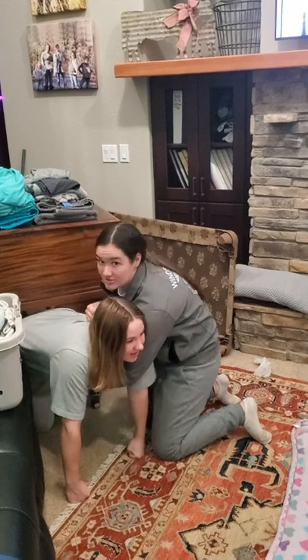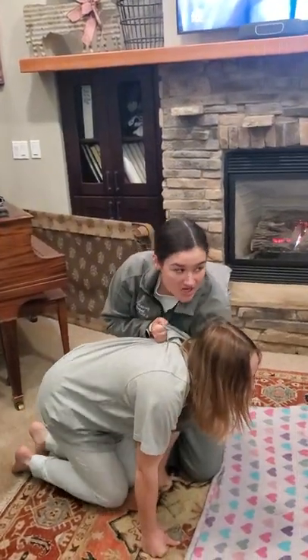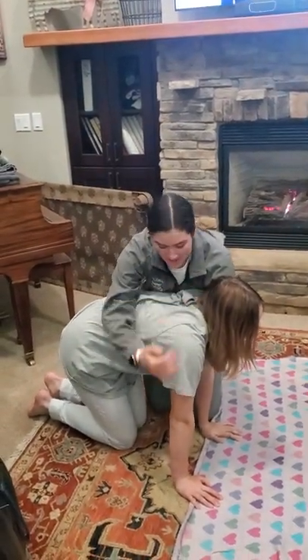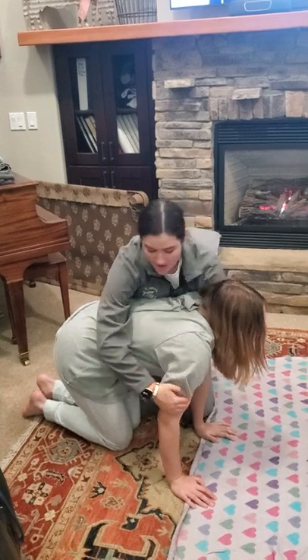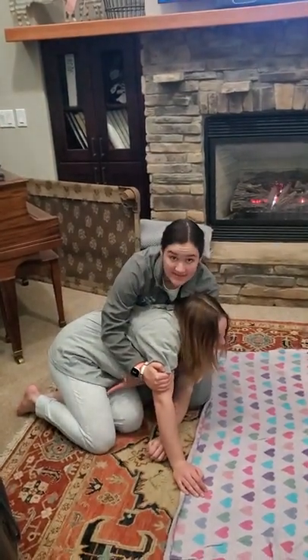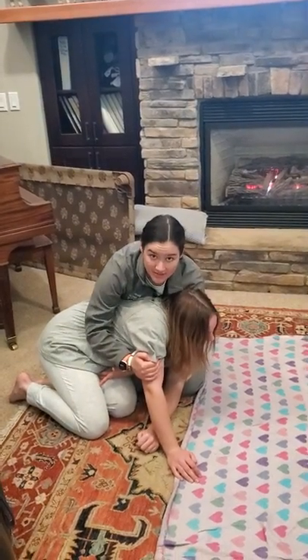So then once you do that, kind of like I have its legs in my hand, you're going to pull it out of its cage. And then when its legs are in your hand, you can let go of scruffing it and rest your arm on it and grab its front side leg. So you grab its front side leg with your hand underneath, holding its legs like this so that it can't escape. And then you have your rabbit completely restrained.